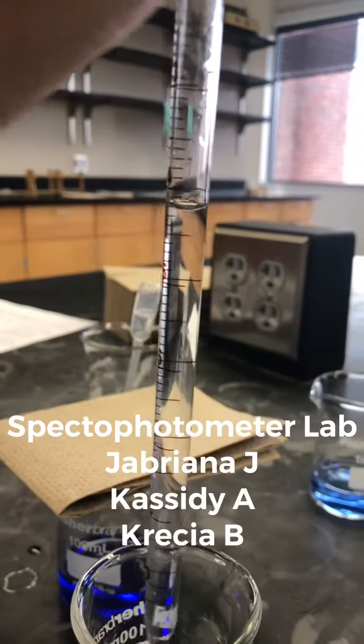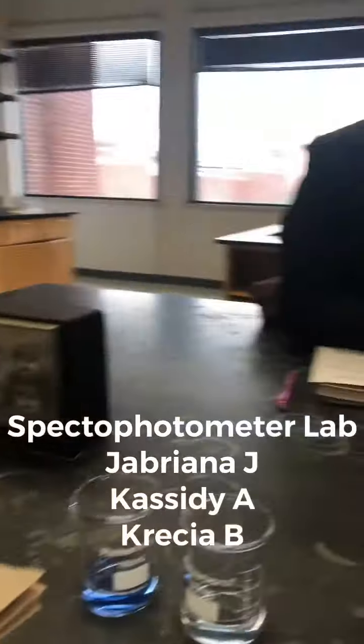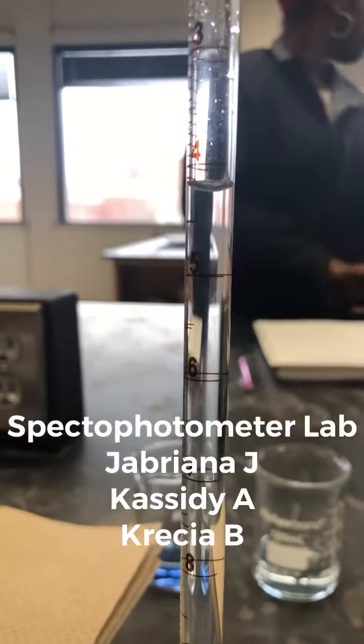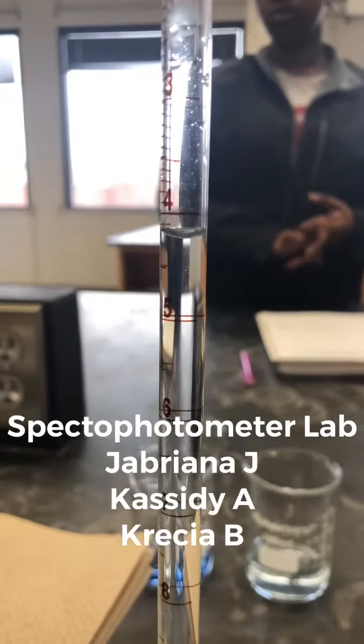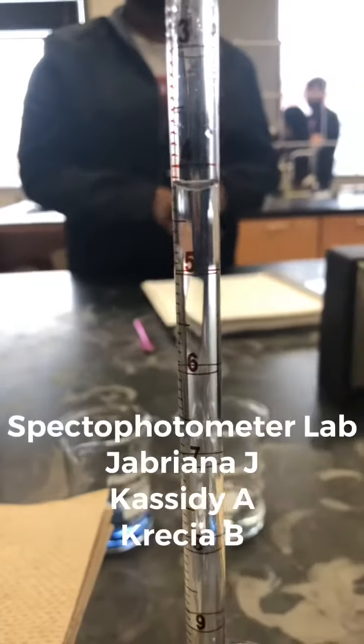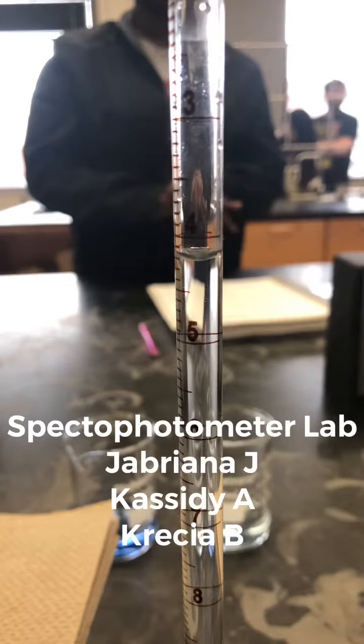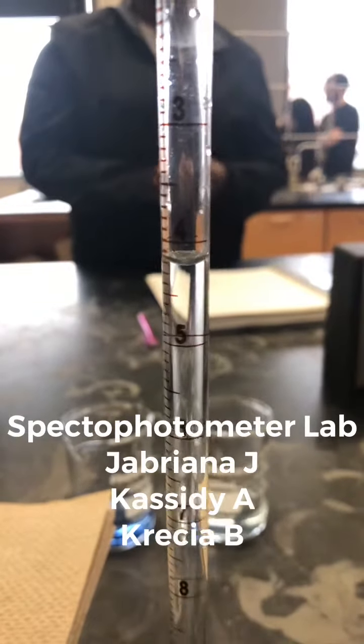You can see here we're measuring the volume using a pipette, and we're doing it by looking at the meniscus. The meniscus is curved because of the water bonding. We use this method for every dilution that we made during this lab. We made a total of 4 dilutions.